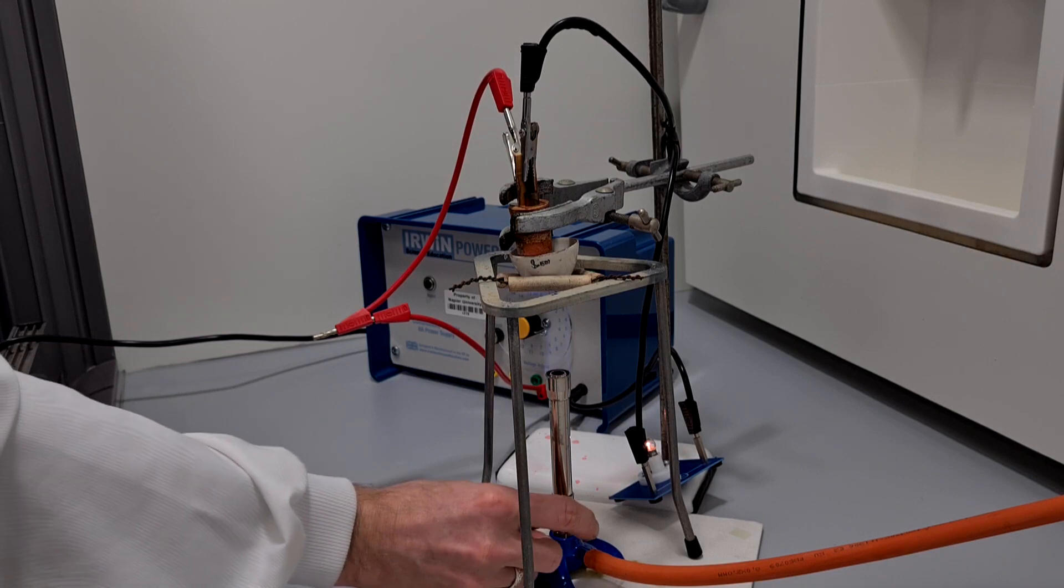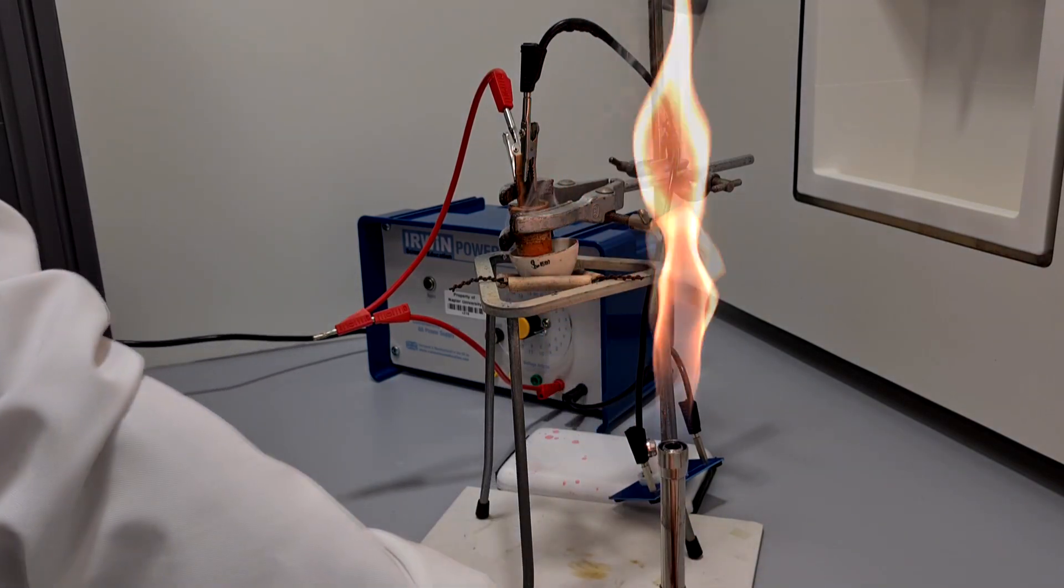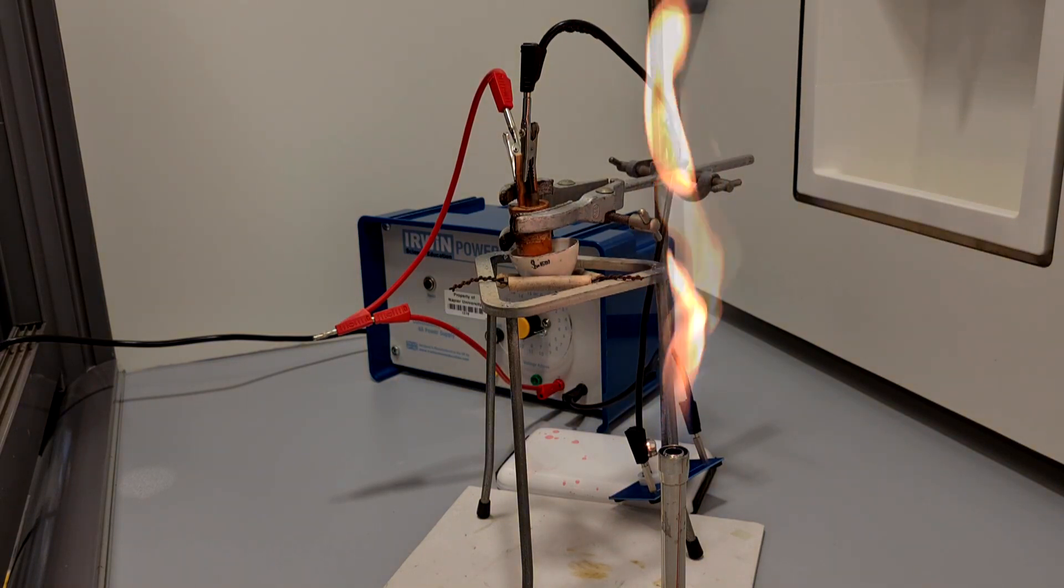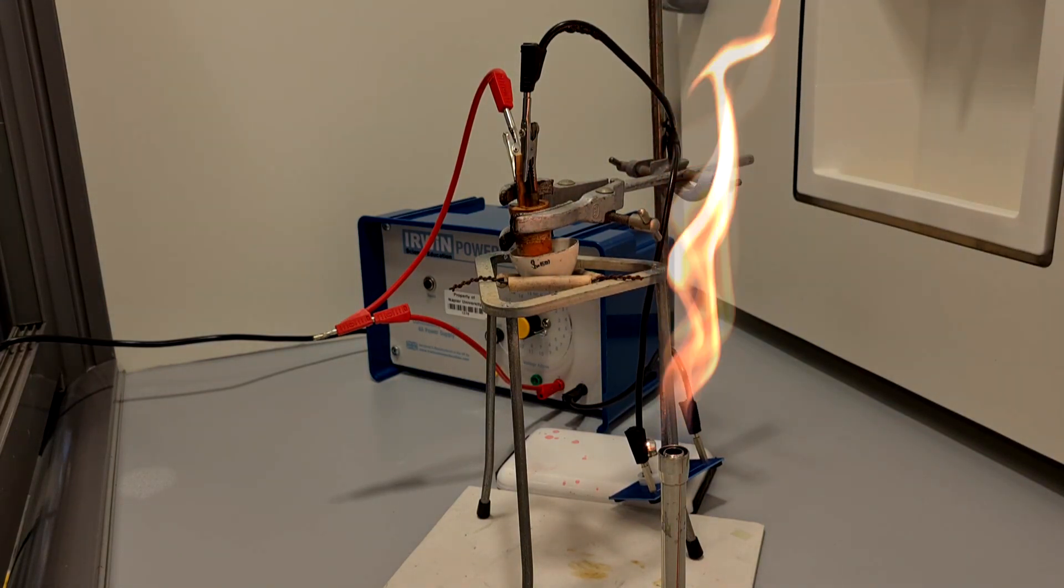If I take the heat away and we allow it to solidify again, we should see that that light bulb will go out again.